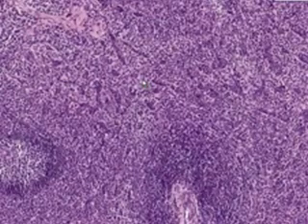What are the various types of cells we could see in the spleen? Well, we could see lymphocytes, that's the number one cell. We could see plasma cells, which are similar to lymphocytes. We could see macrophages, also called histiocytes. We could see granulocytes. We can see reticular cells because they produce the reticular fibers, like we said, was in all lymphoid organs. We could see blood vessels. We could see any type of cell in the peripheral smear, because all of the cells which are in the blood eventually get chewed up and die and recycled in the spleen, and that's the main function of the spleen.